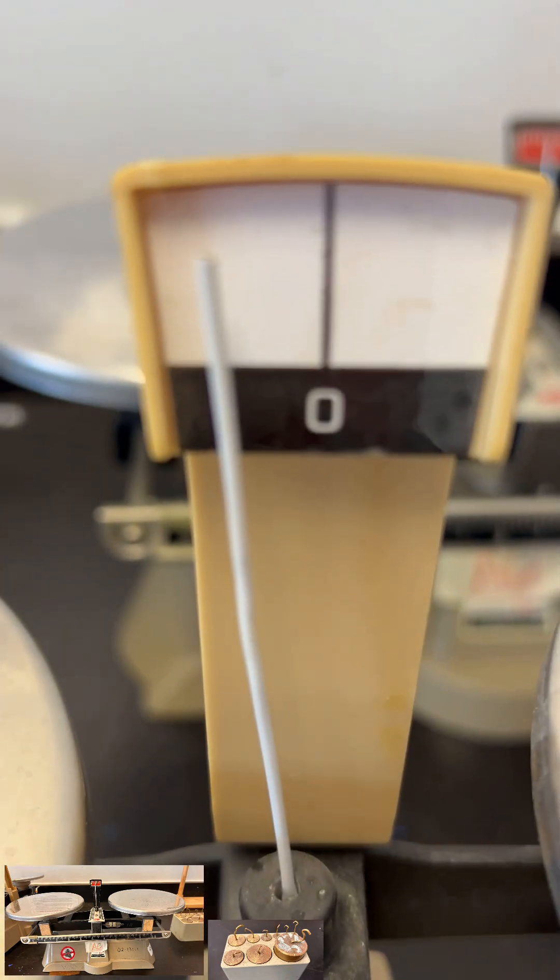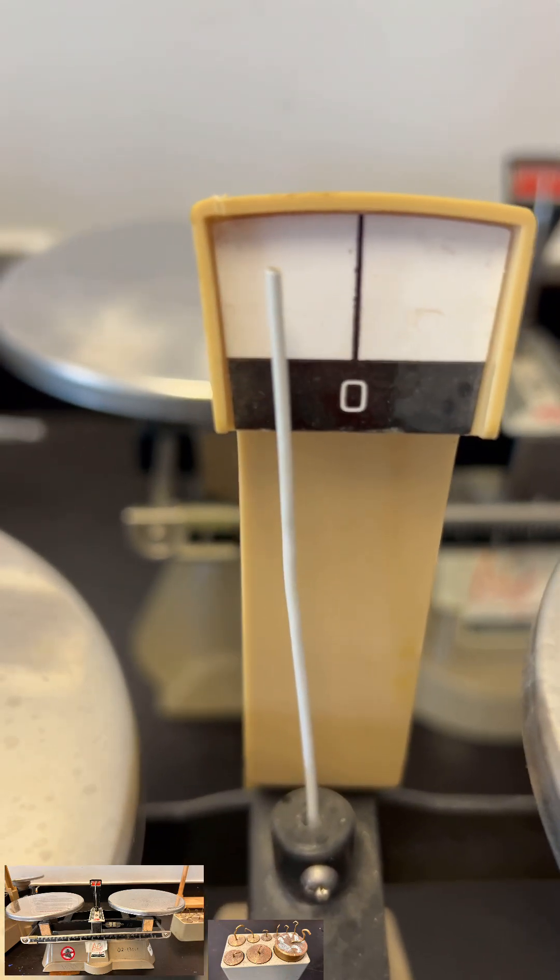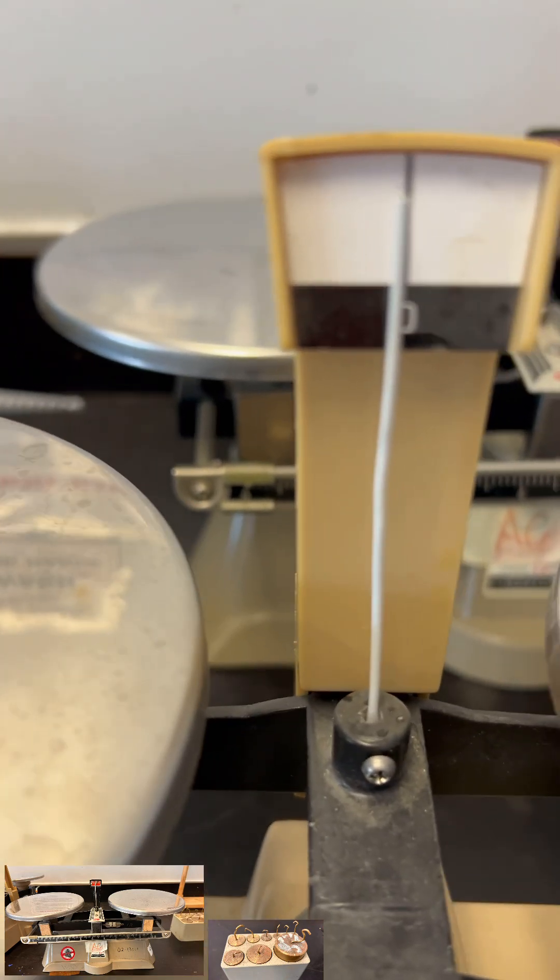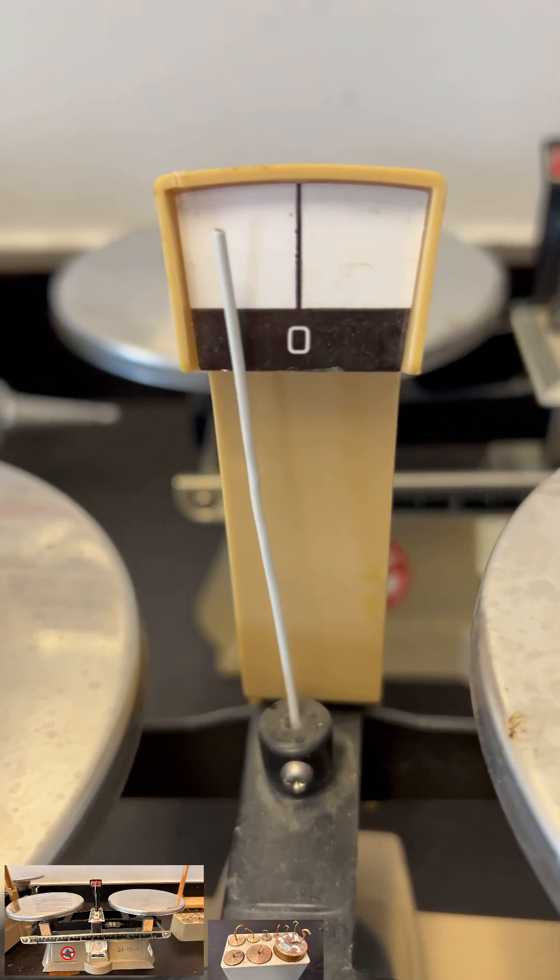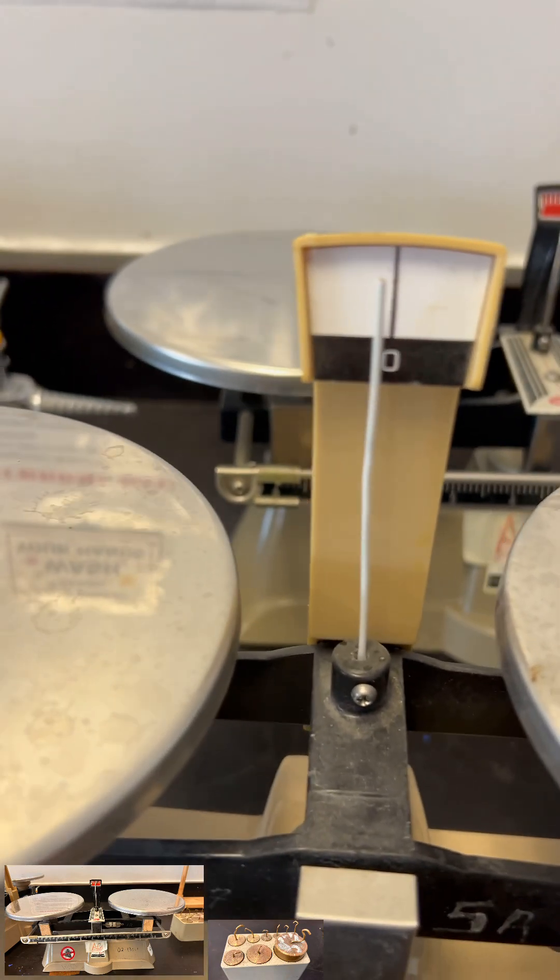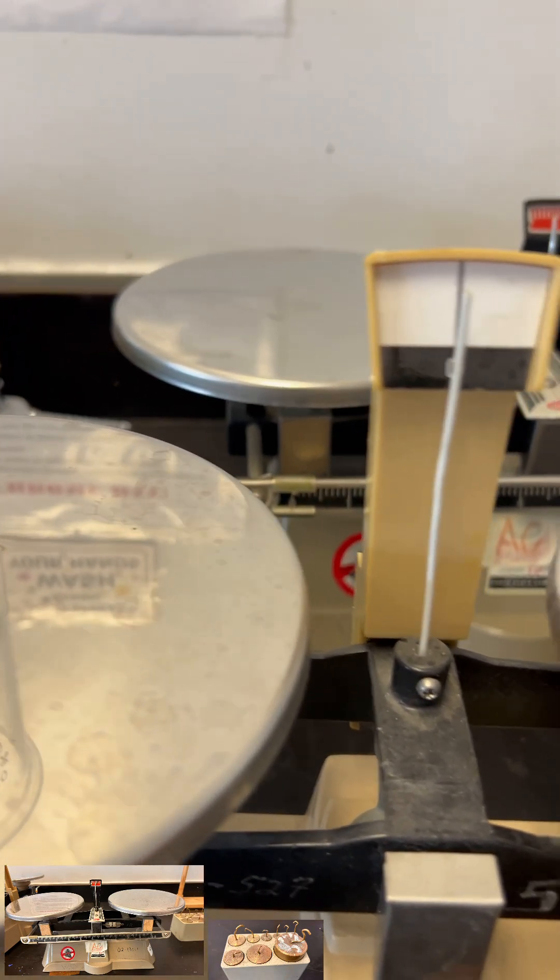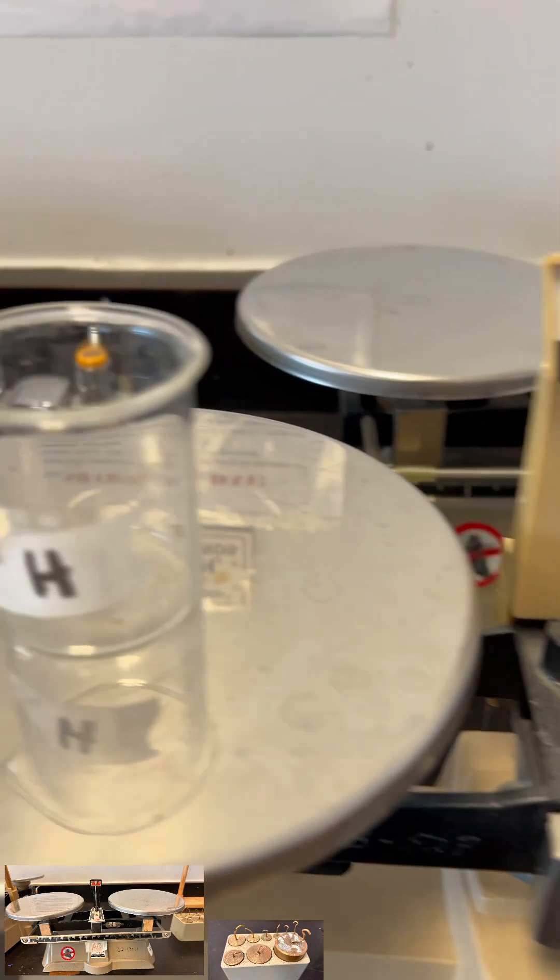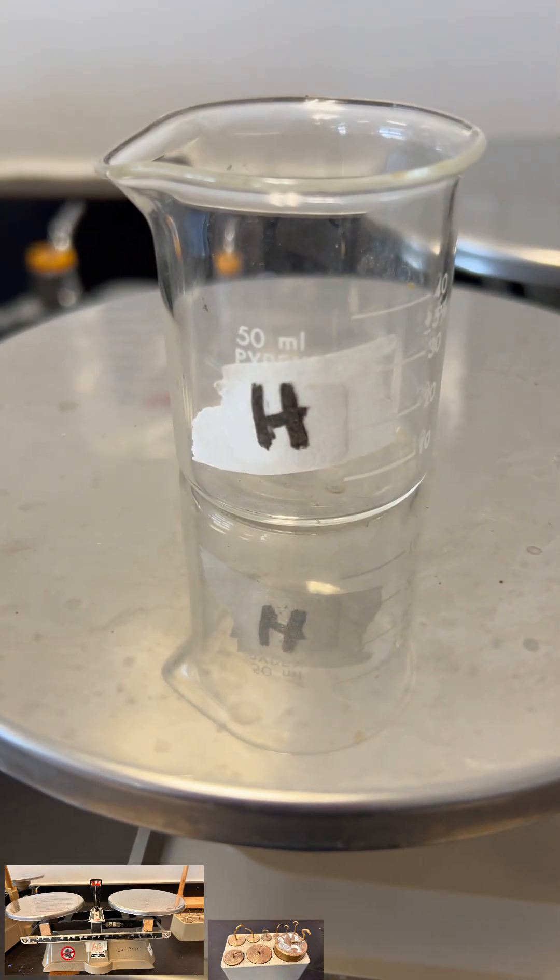Is this balanced or is the needle centered? No, so you need to adjust this, maybe farther to the right, until everything is centered. At least when the needle is centered, then you know that you get the correct weight.